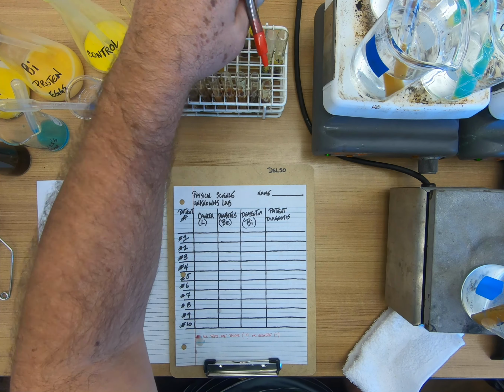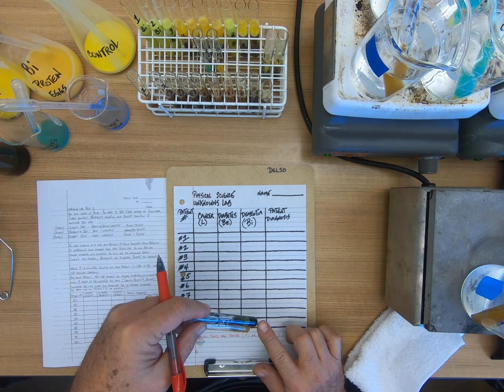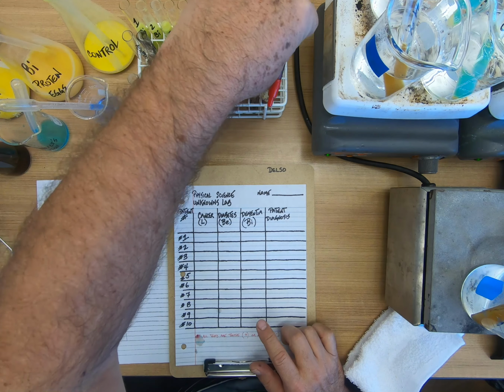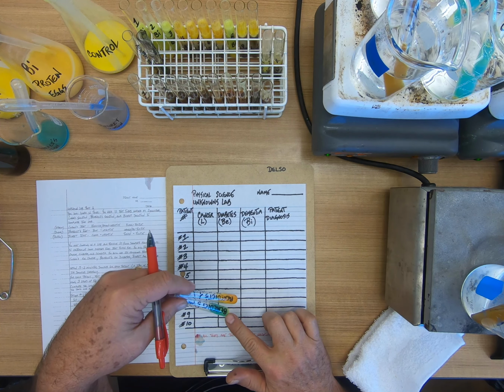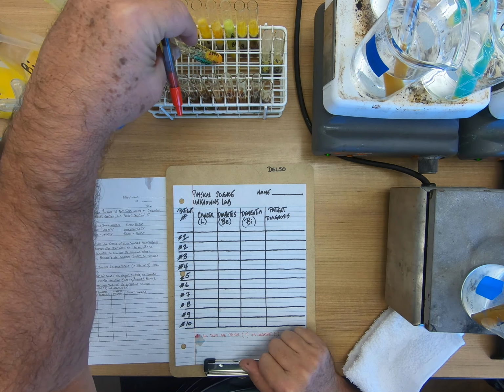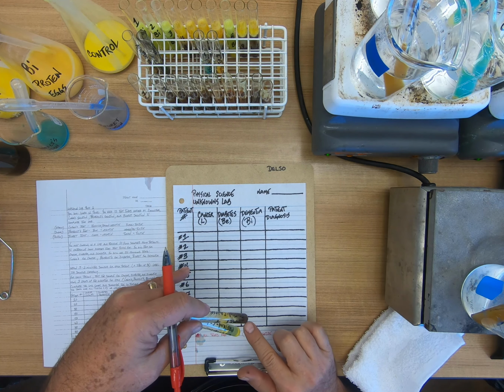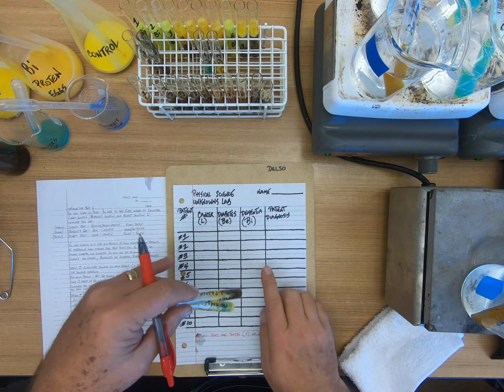Here is your positive and negatives one more time. This is the negative. This is the positive for Lugol's for the cancer. This is the Benedict's test. It is for diabetes. That's a negative diabetes test. That's a positive. And for the Biuret's, this is a negative. That one's a positive. Notice that there's still some yellow at the top, so if it is purple down towards the bottom or dark, that's a positive Biuret test for dementia.